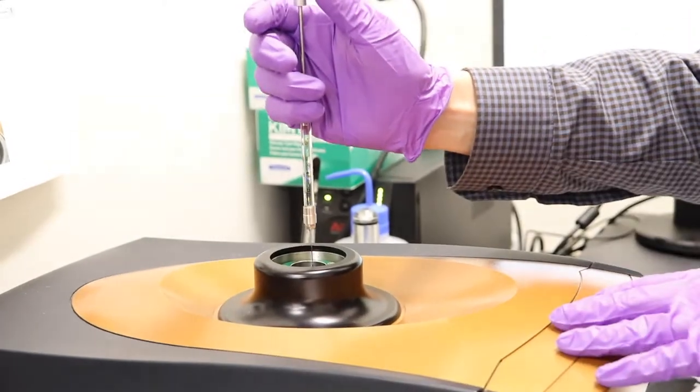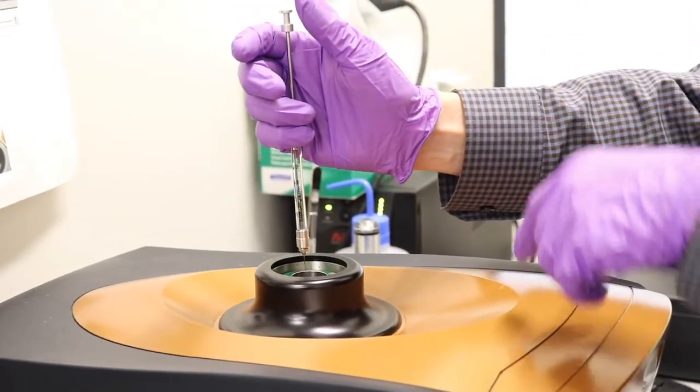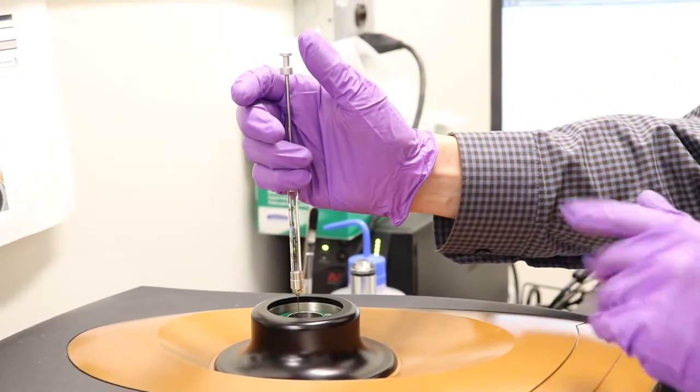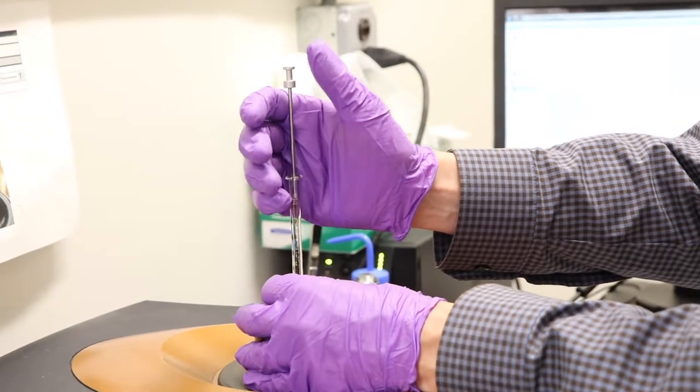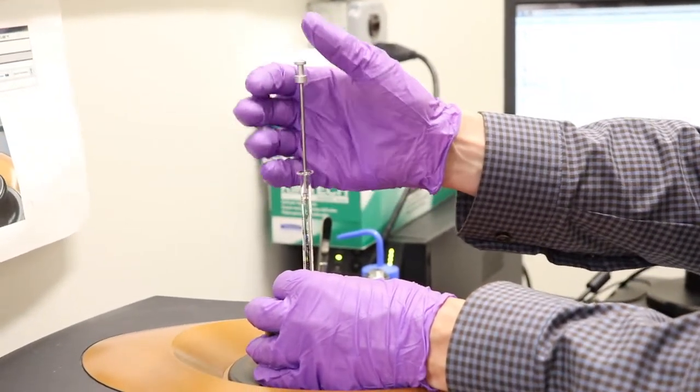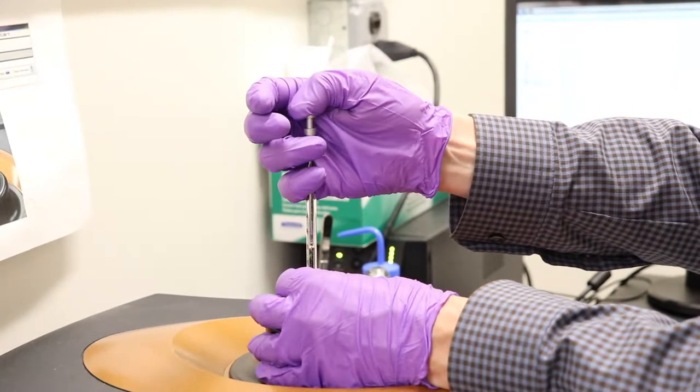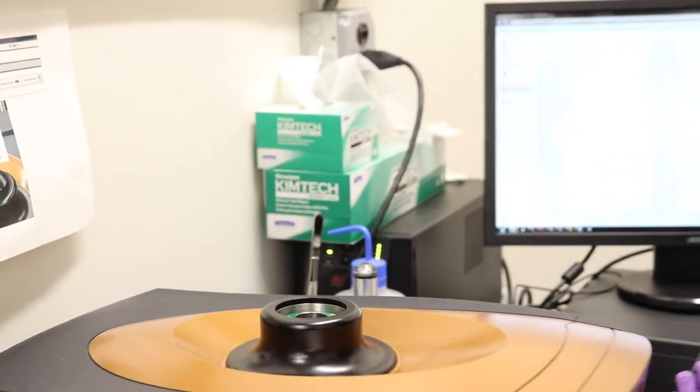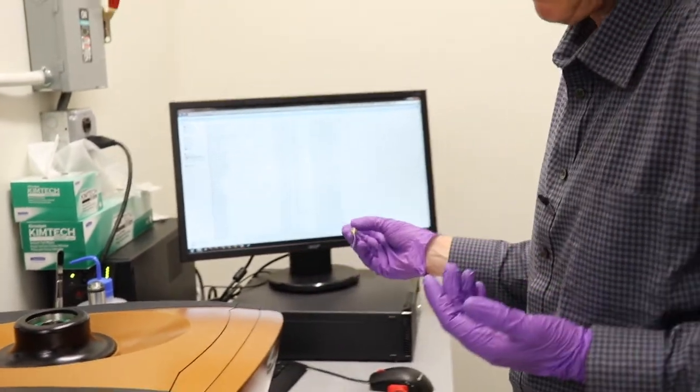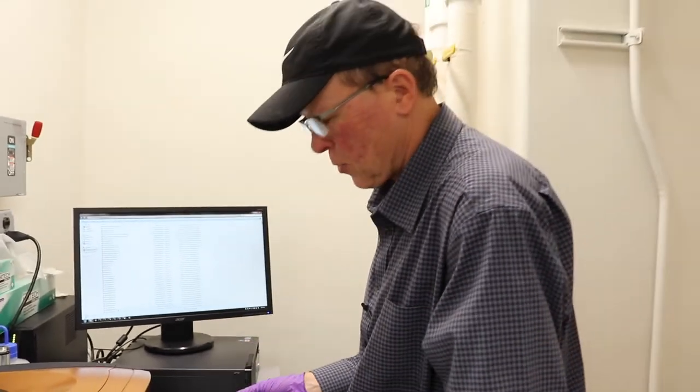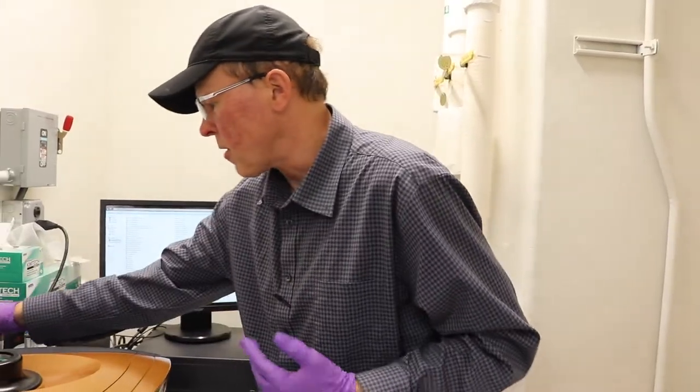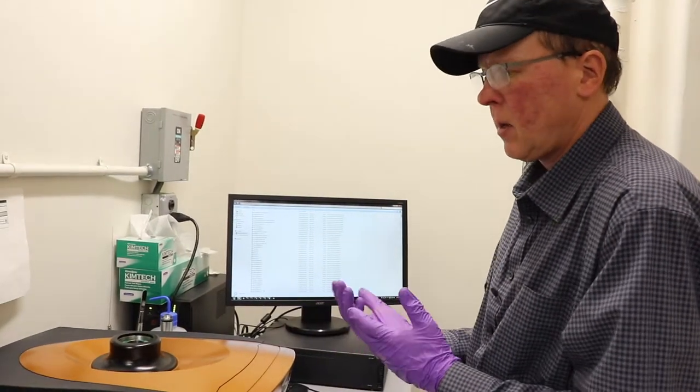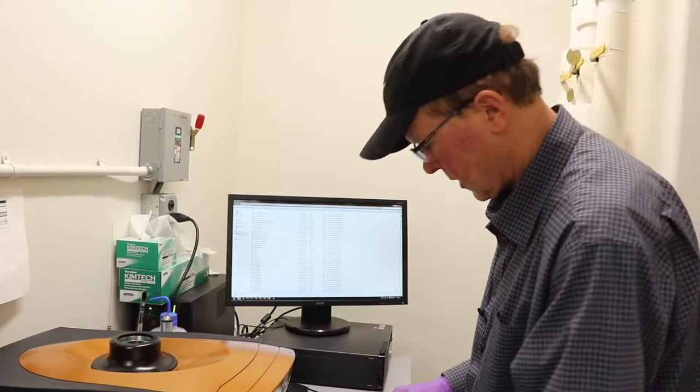Now the sample cell is the opening in the middle. There's also a reference cell in there that has a plug in it. You guys should not have to worry about the reference cell at all. I check that about once a month just to make sure it's okay. So please don't change that. So then to put 350 in, I'll go from 500 down to 150. Our sample's loaded. And that would be the same sort of technique as if you want to put your protein sample in. Rinse it three times with your buffer to prep the sample chamber and then put your protein in the same buffer into the sample chamber.